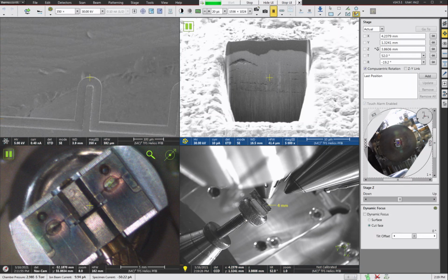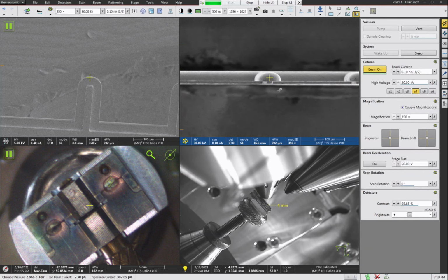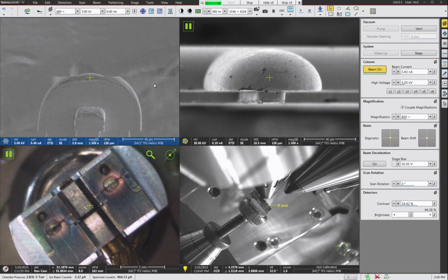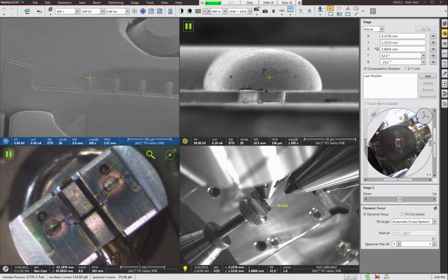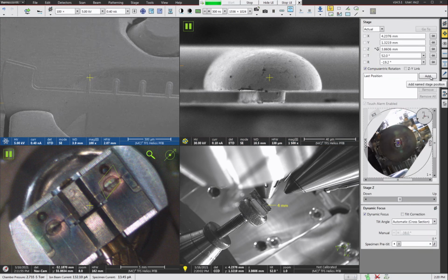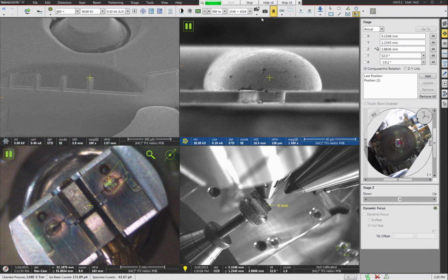And I'm just going to use kind of a medium beam current here just to focus and make sure the alignment of the grid finger is correct by fib. Let's see here. Fib. So I'm just going to zero my beam shift, put that top of the grid right in the center of the fib image, and check that my SEM is also looking at the top of the grid. That should be fine. And let's go ahead and we're going to just save this stage position. And then let's go find the other grid fingers. So we've got the one on this far right here.